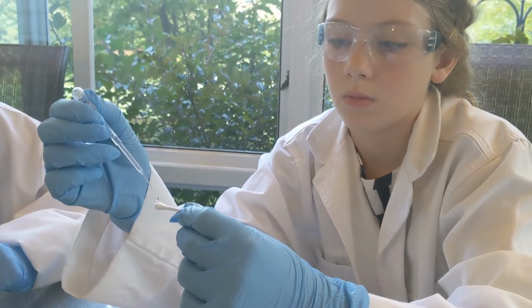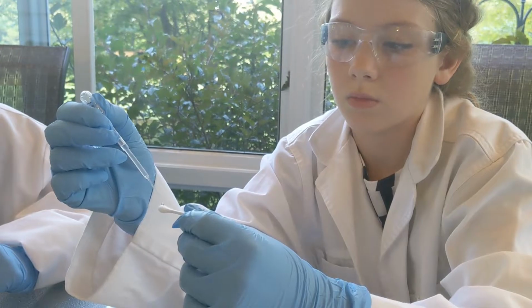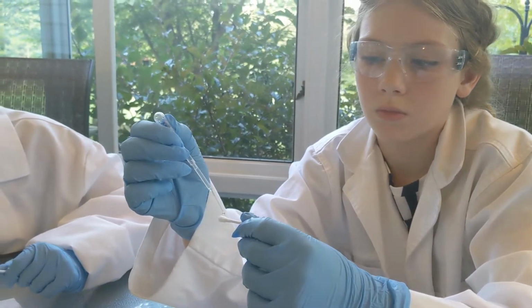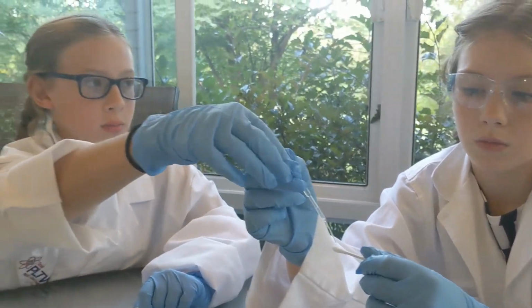What does the N mean? Actually, if you turn it sideways, it's a number. Okay, good, Lil. 2. Pass it to Taylor. Oh, the 2. Yeah, so you got sample 2.